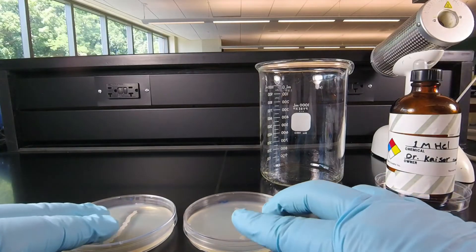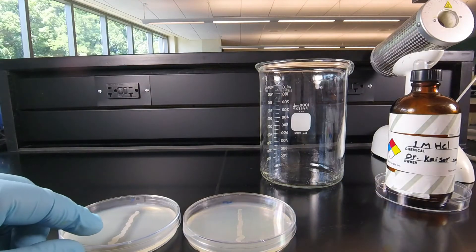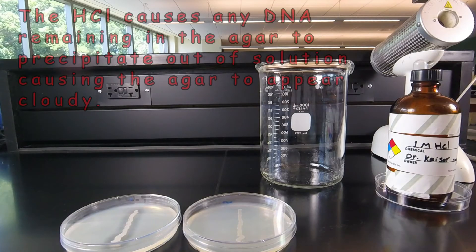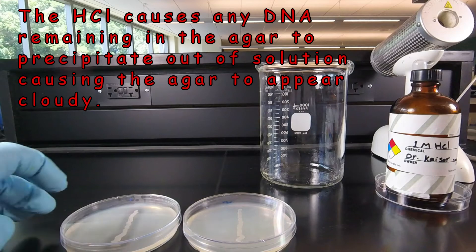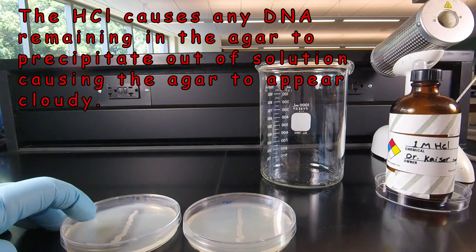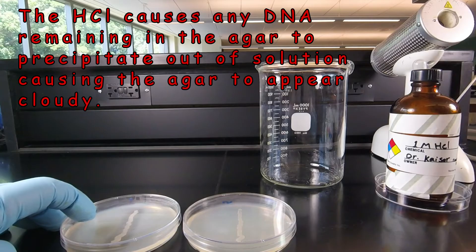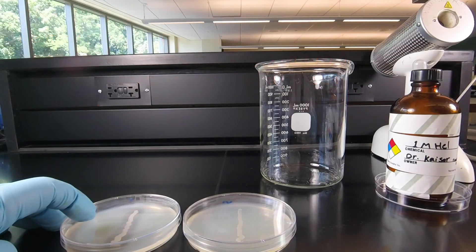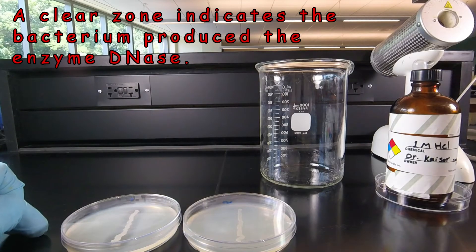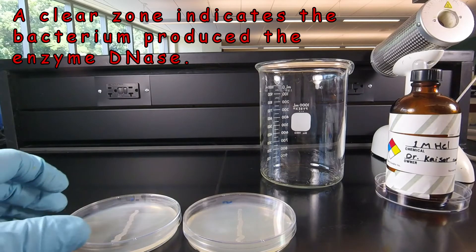We're ready to look at the results. We can see pretty clearly that the organism on the left has a nice clear zone around the growth. The reason for that is that the acid we added causes any DNA remaining in the agar to precipitate out of solution, and when the DNA precipitates out, the agar becomes cloudy. So anywhere the agar appears cloudy or opaque, the DNA is still present. If we see a clear zone around the growth, that indicates there's no longer any DNA around the growth.